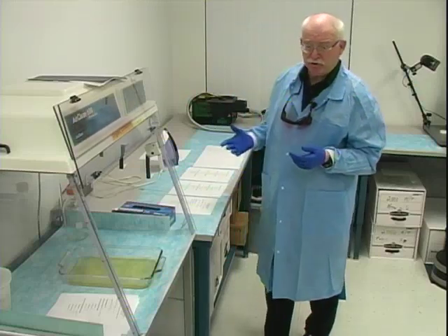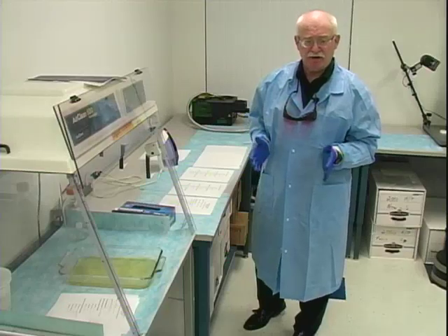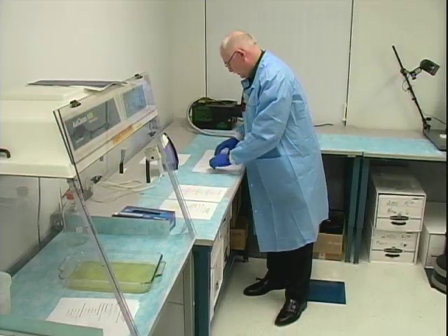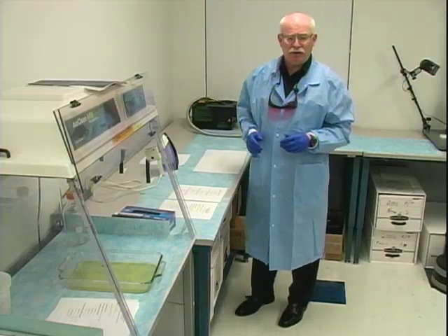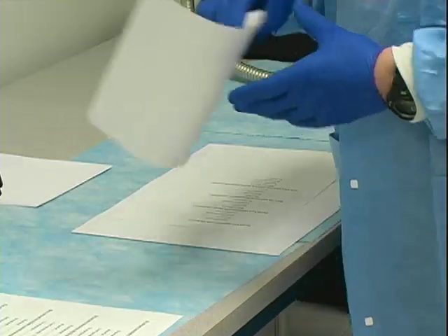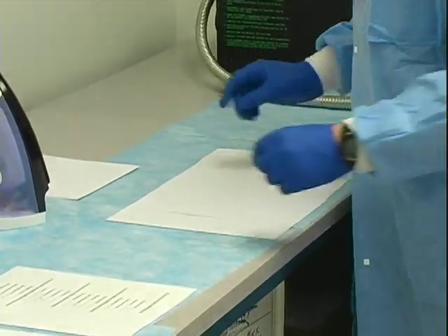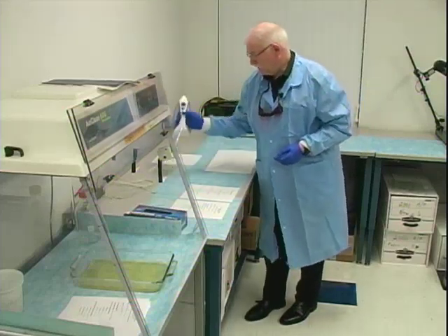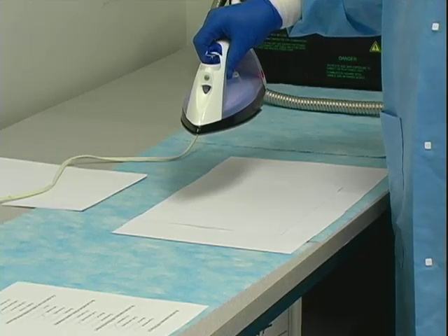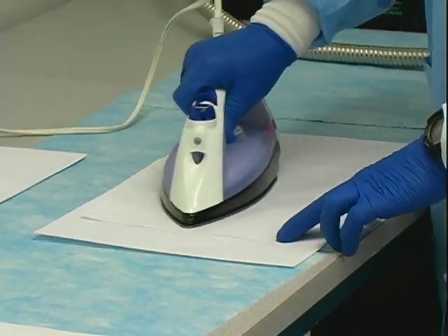For the purpose of this workshop, we are going to use an ordinary household iron — definitely without water. It is a dry iron set for the wool setting. The recommendation from the Australian Federal Police is to place the exhibits between pieces of clean bond paper, such as you would take from your copy machine, and then apply heat for ten seconds to the entire surface using a dry mounting press or t-shirt press.